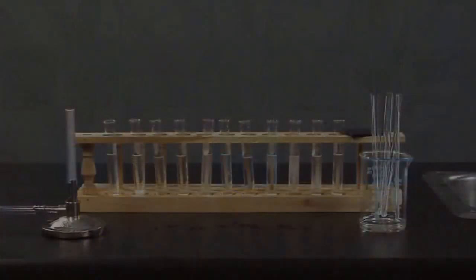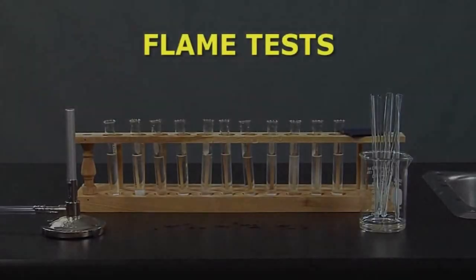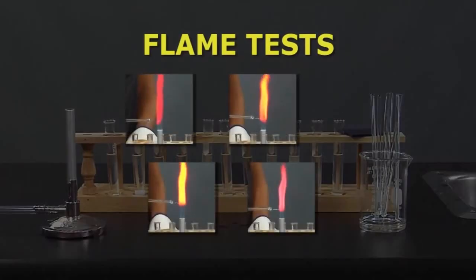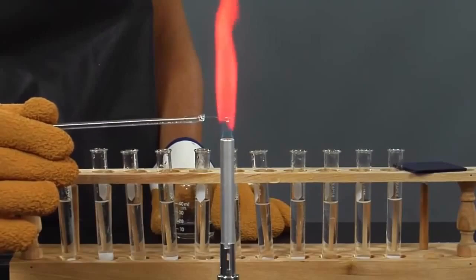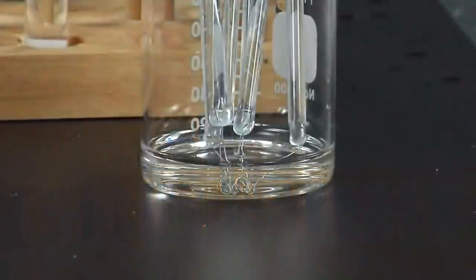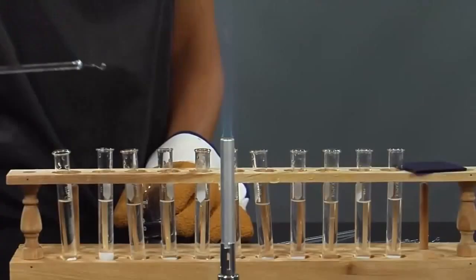We will do qualitative analysis of the substances by conducting flame tests. This type of test requires us to first identify the flame color produced for each of our known substances. We will do this by using a platinum wire and dipping it into the known solution, then putting the wire into the flame to see the color it produces. It is very important that between tests the wire is cleaned in hydrochloric acid so that we don't get any misreads. Observe what happens when each substance is tested.